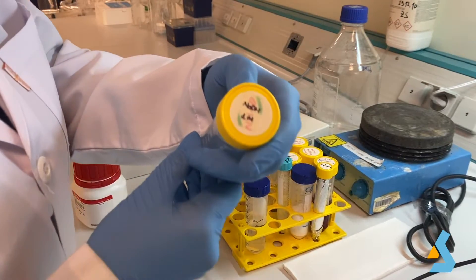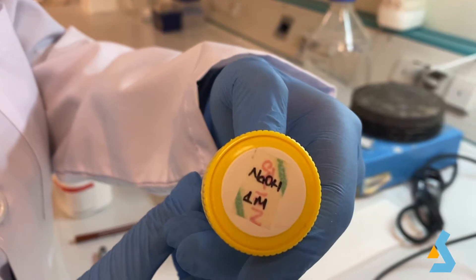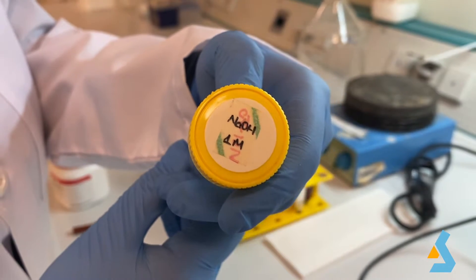In order to see how this glycine solution would react to addition of a basic solution, we will take measurements after every titration of 1 molar sodium hydroxide.